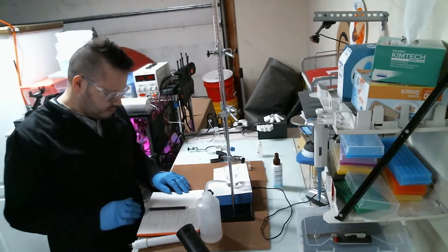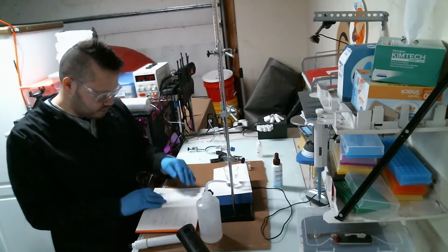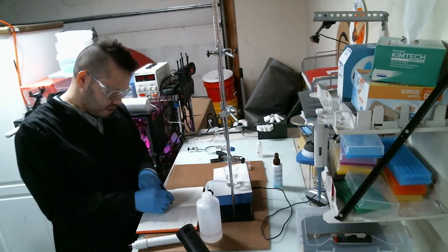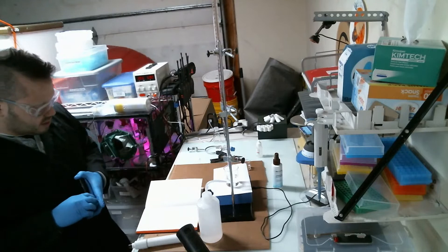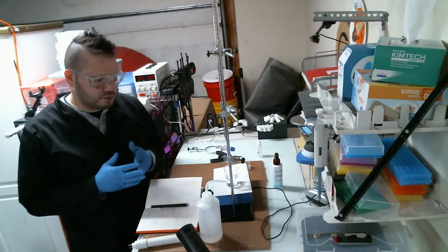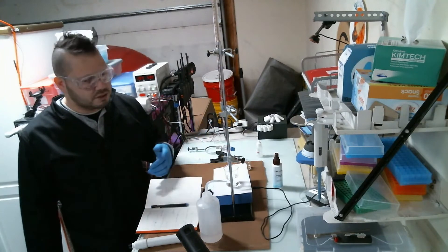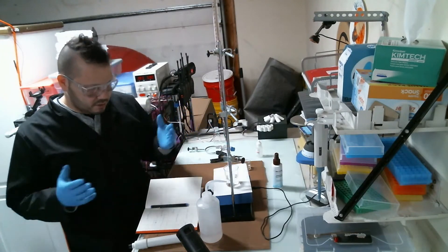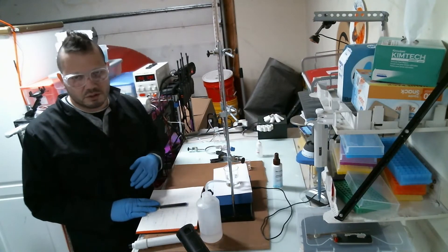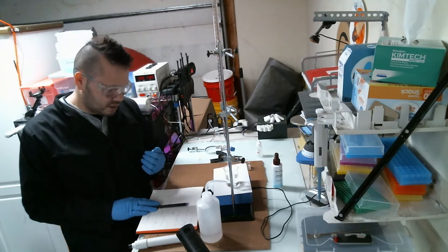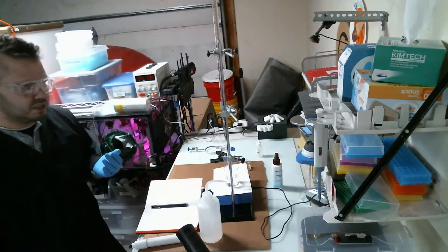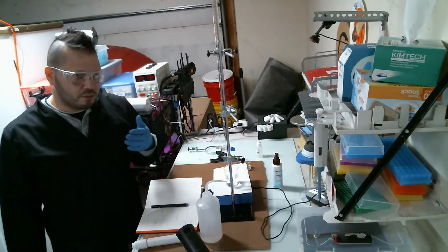In this case, it's actually right up there where it needs to be. Now one thing I do like about this is I was able to actually confirm it's 1.35 molar, because I like working in moles - I don't like doing percentages. Moles make it easier when you're doing chemical reactions because then you know if this is a one-to-one reaction, you need, you know, 10 moles of this and 10 moles of that. If you need 13 moles of sodium hypochlorite, well that's 10 liters of your solution, which is a lot. But if you need 0.135 moles, you need 100 milliliters.